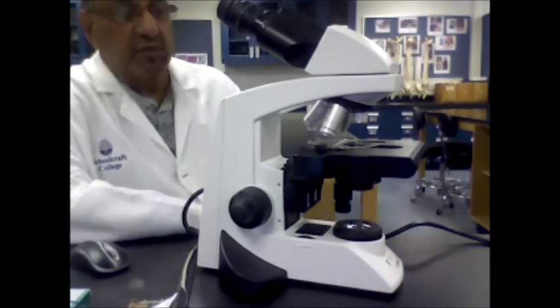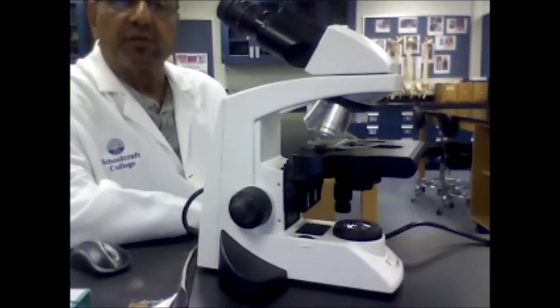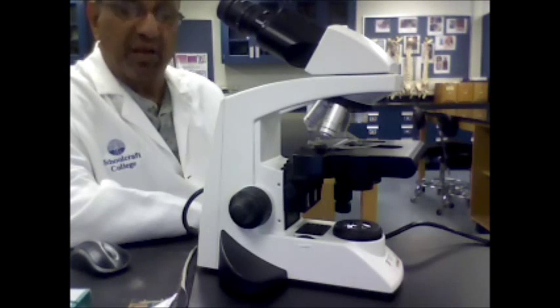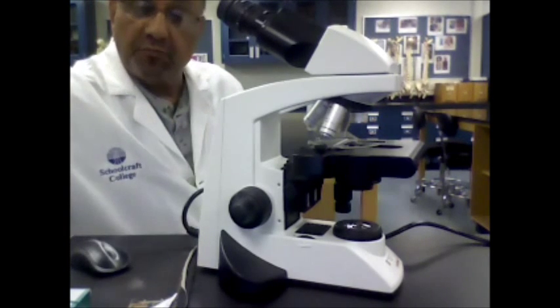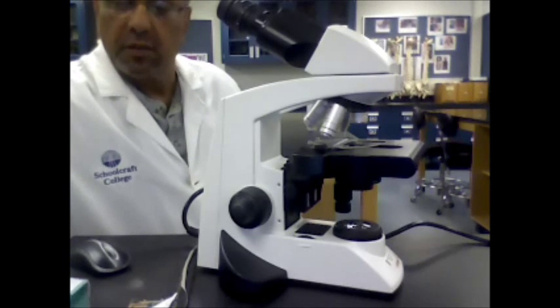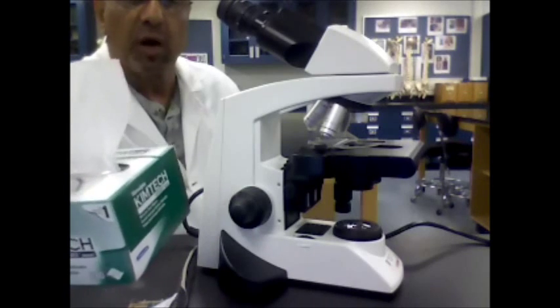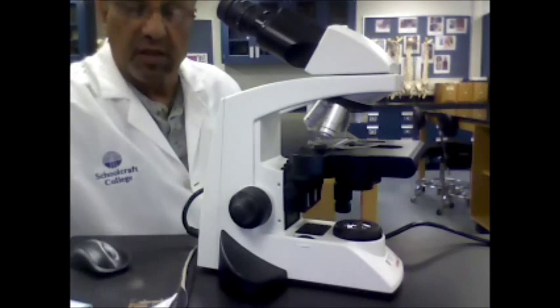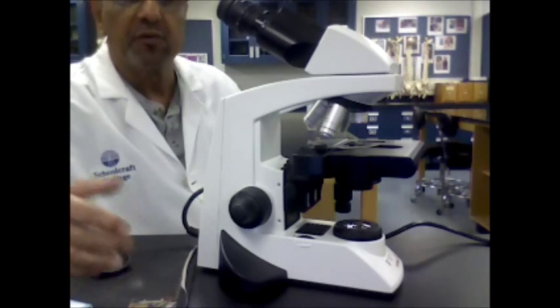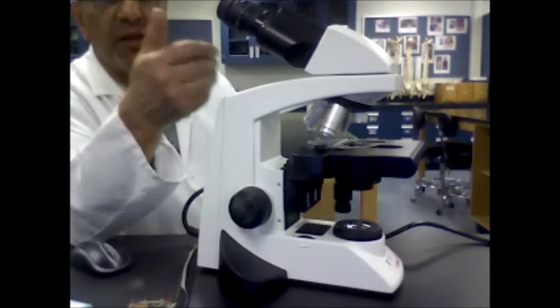The first thing you want to do when you get your microscope to your table is to be sure that the microscope is clean. We have two products available for you: Kim Wipes and Lens Paper. You can use either the Kim Wipes or the Lens Paper to clean the lenses.